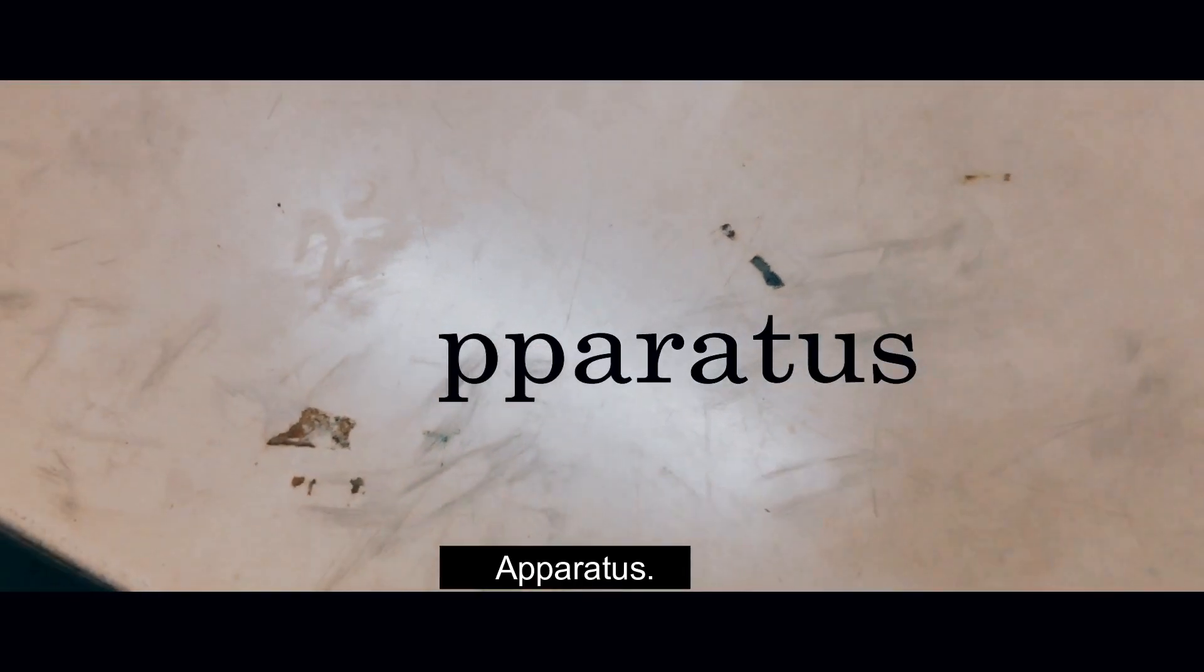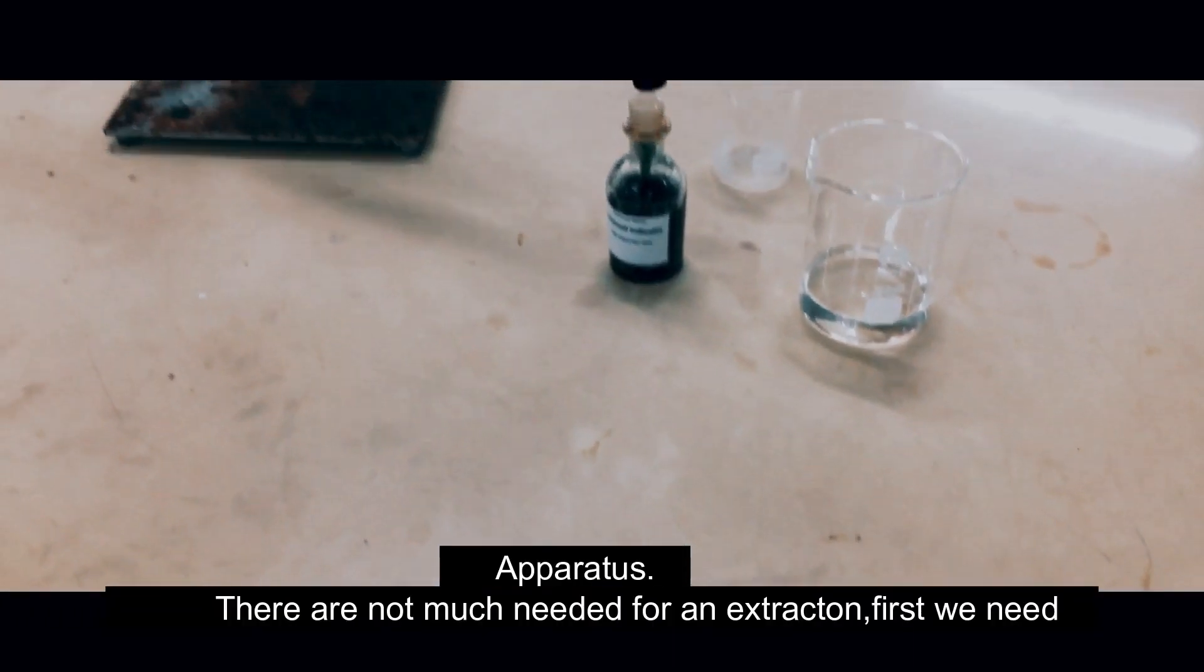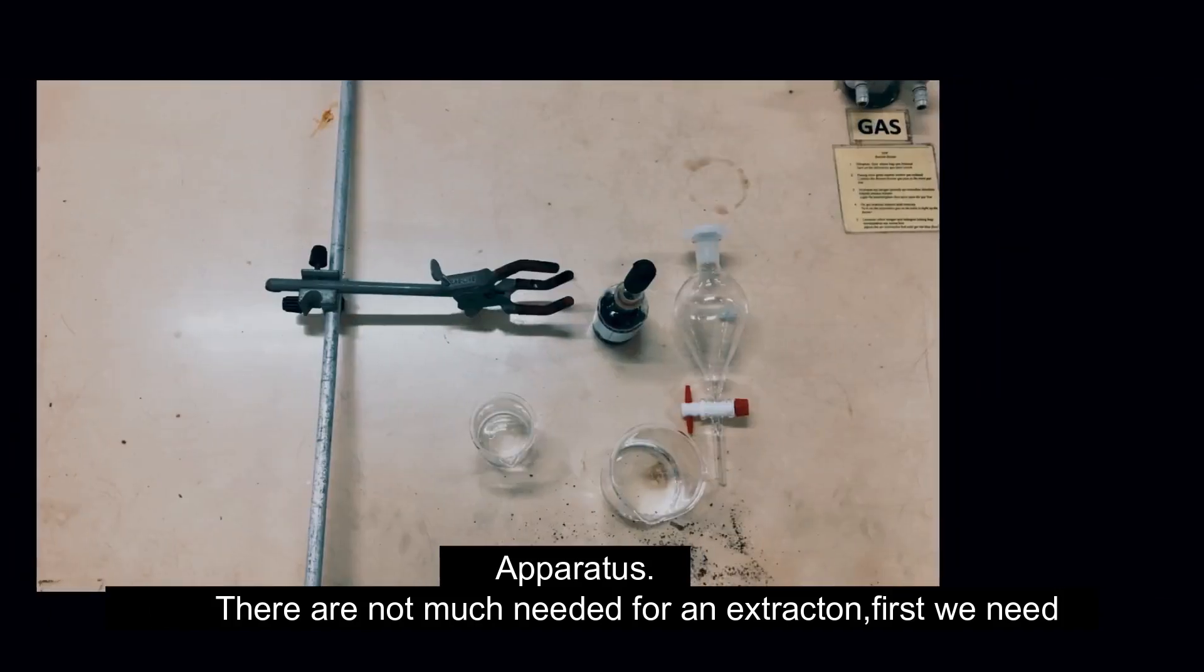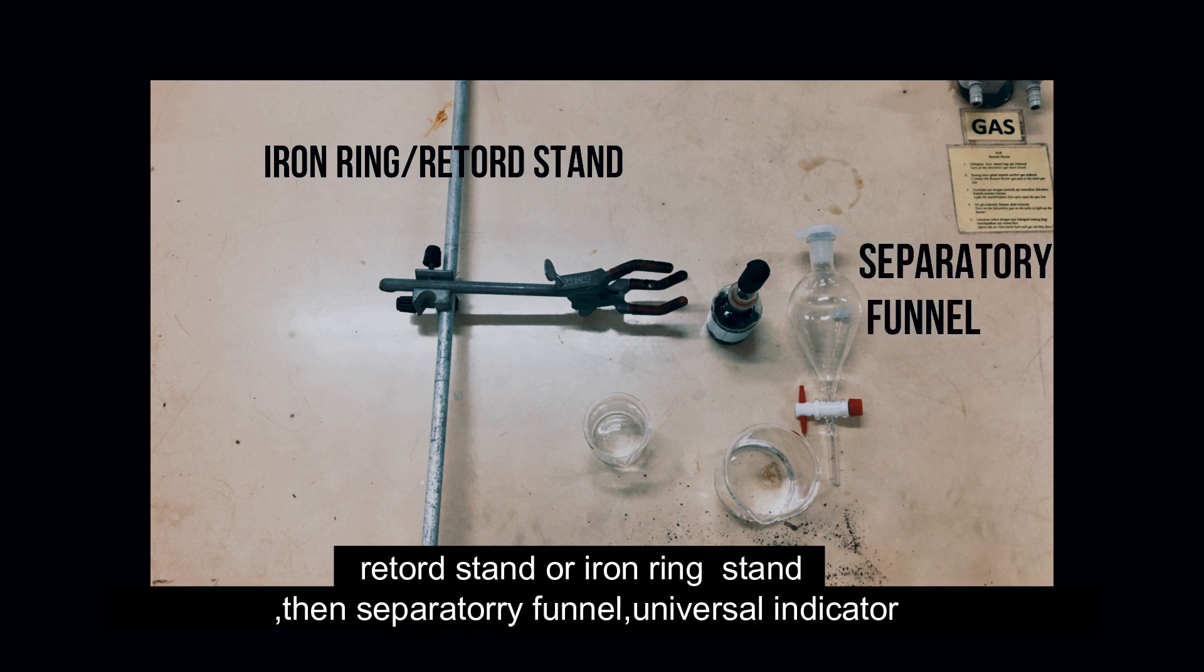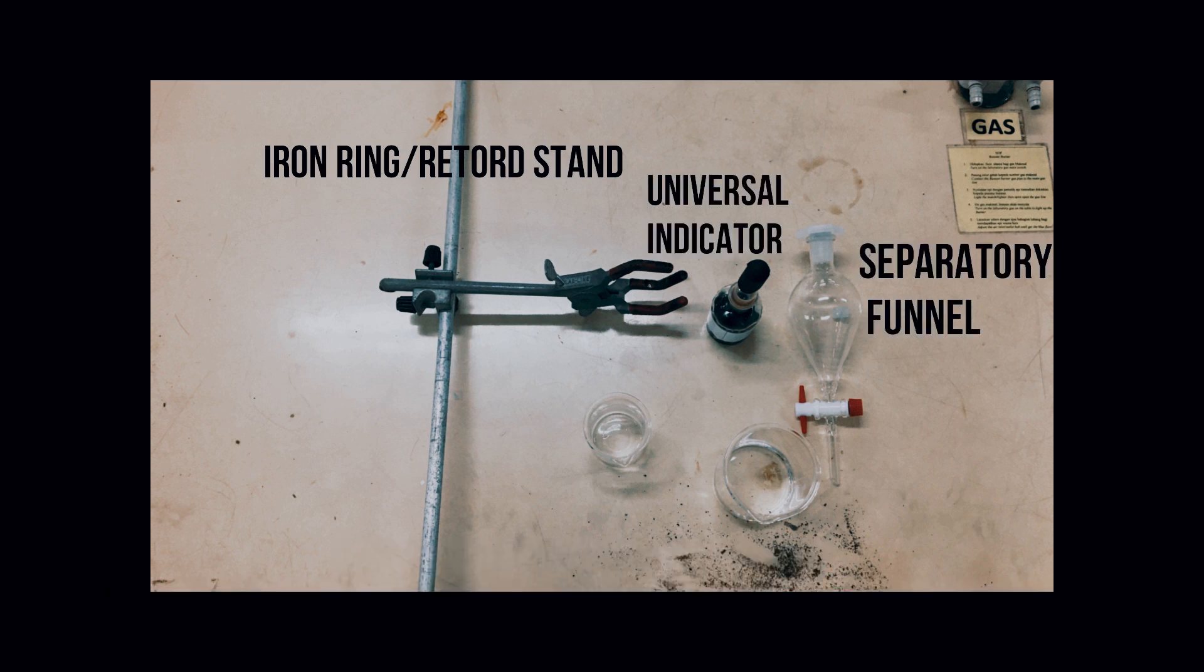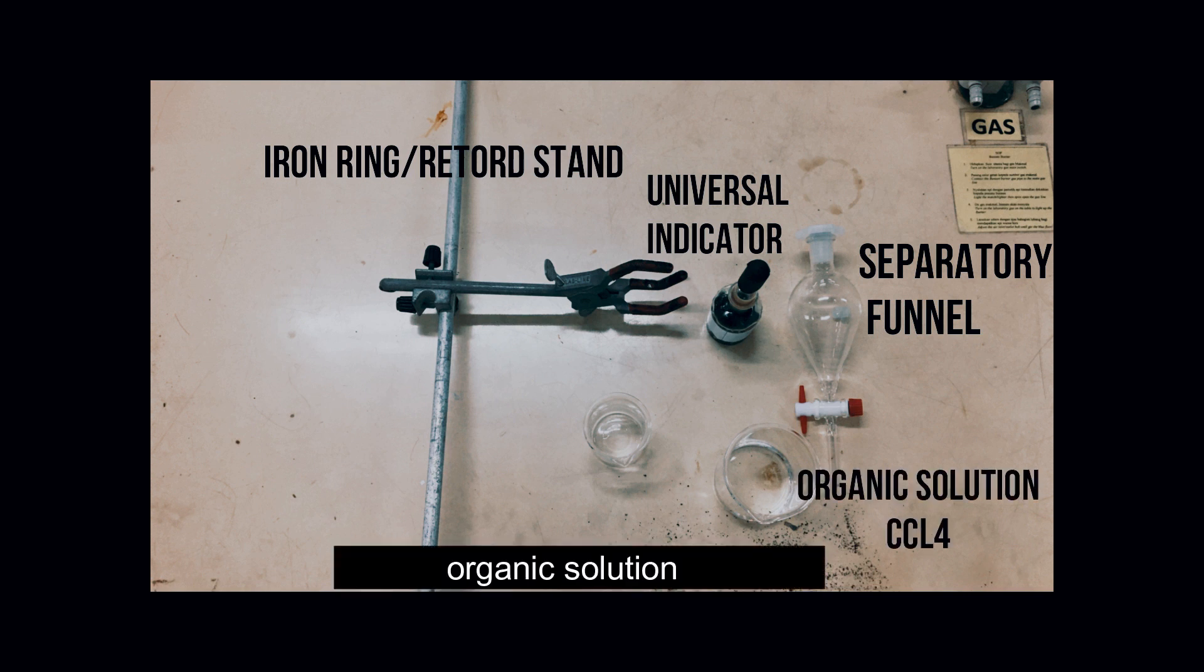Apparatus: There are not much needed for an extraction. First, we need retort stand or iron ring stand. Then, separatory funnel, universal indicator, organic solution, and lastly, a beaker.